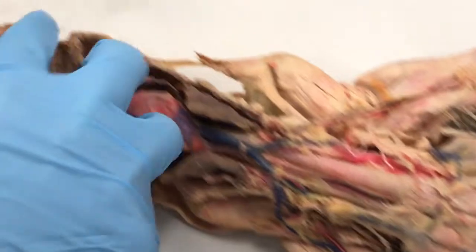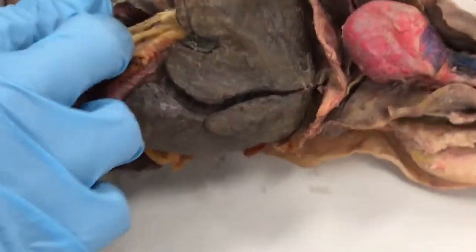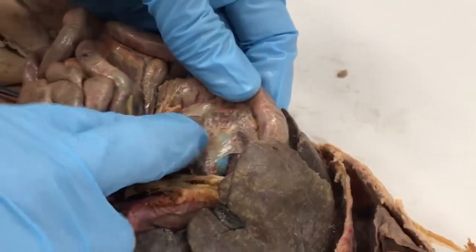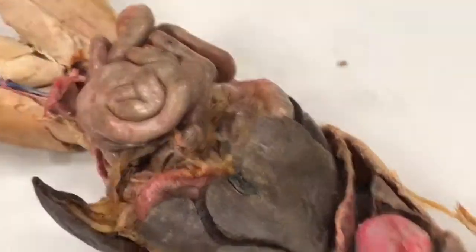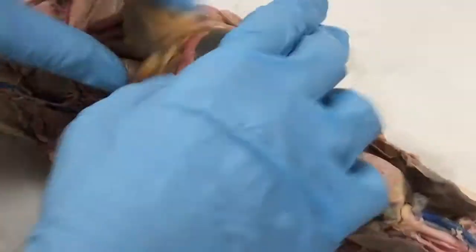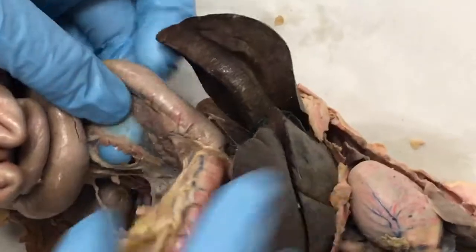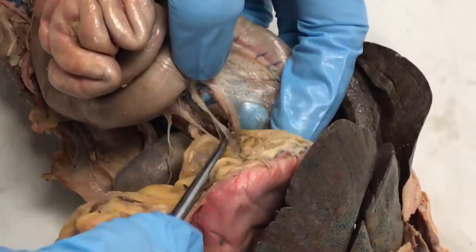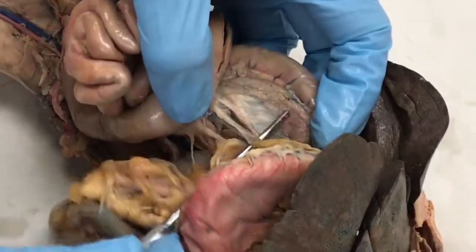And there's one more vein we need to know associated with the hepatic system called the hepatic portal vein, and it runs right along with the pancreas. So it's right here. It's probably a little bit better on this cat, I think. So we find the pancreas, and then on some cats it's dyed yellow, and these not so much. So it's just a sort of brownish blue color right here. Hepatic portal vein right there.